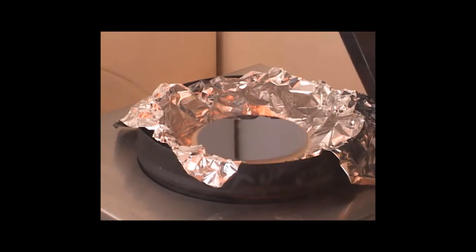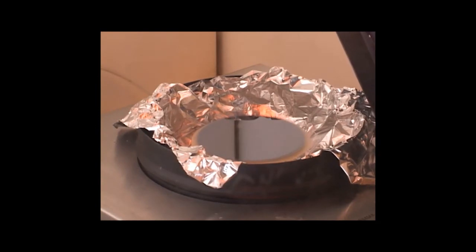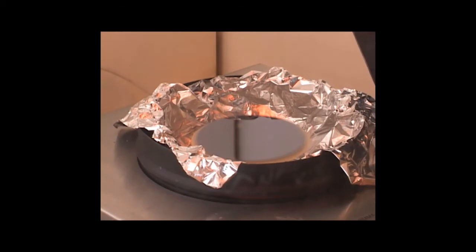As the thickness of the coating changes, you'll see the color of the wafer also changes, until we reach our final thickness. And the resulting wafer, 300 nanometers thick, should be green color. Full spin time is 45 seconds.